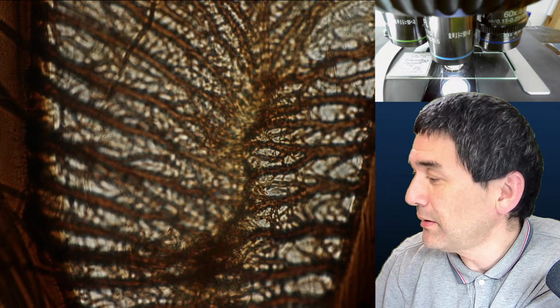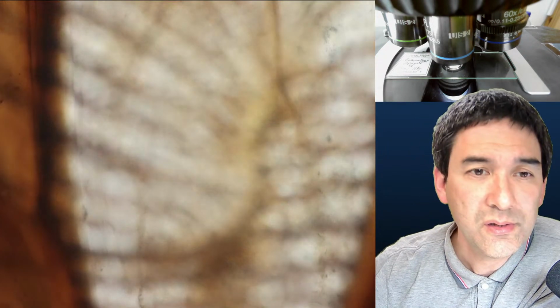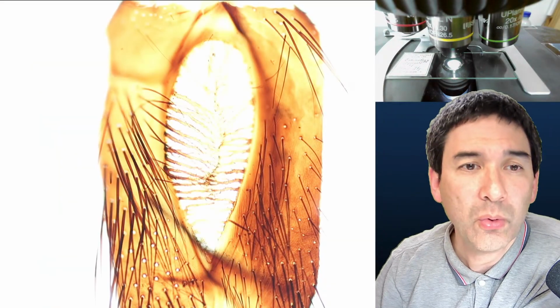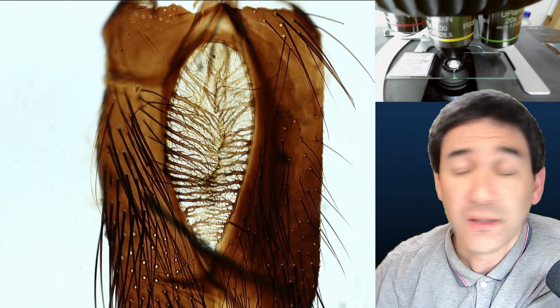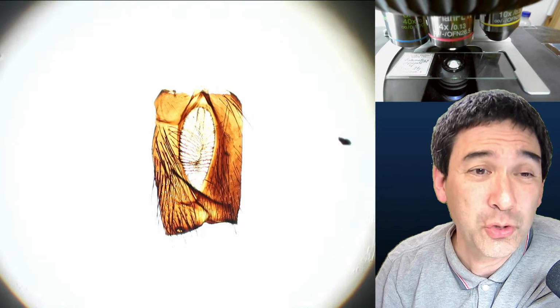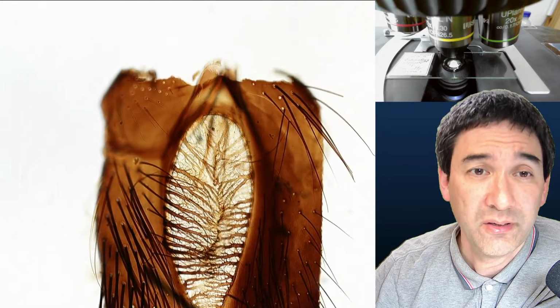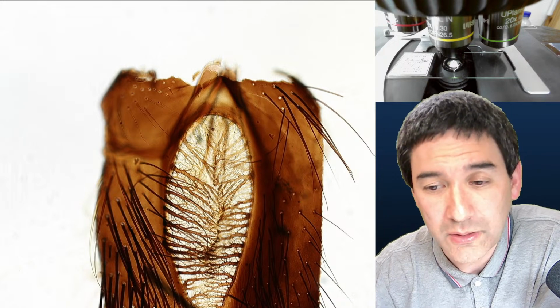Of course, maybe I forgot the condenser. But it would be nice to have a more or less complete view of this. With 4 times, I'm able to fit it in on one picture, but that's too small. I want to see more details. So I go up to 10 times, and then I can already see it doesn't fit, right? So this is the thing again.